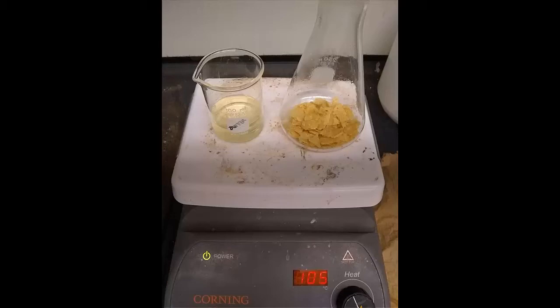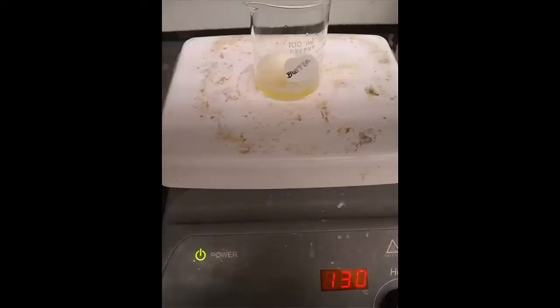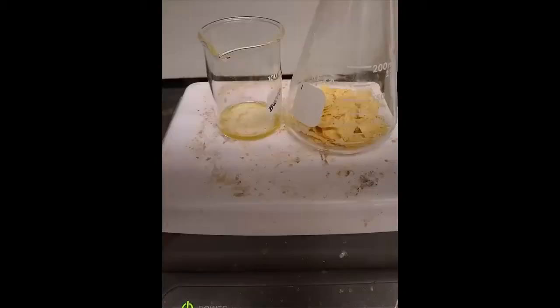At 105, where the plate is at 105, it was pretty slow for the ether to boil. So we ended up actually turning up the plate to about 130. During that time we were measuring the chips back and forth to make sure there wasn't any change in weight. And you can see if you look closely, the ether is starting to boil here. So slowly that ether was boiling off. There wasn't a significant difference, but you'll see in a second that we ended up putting the chips back on the plate for a little bit longer anyway just to check it.